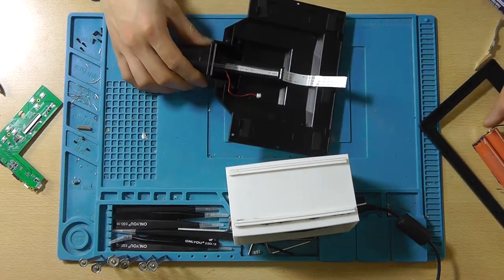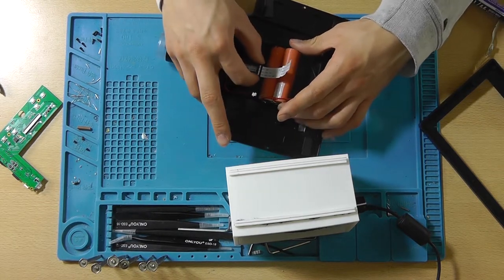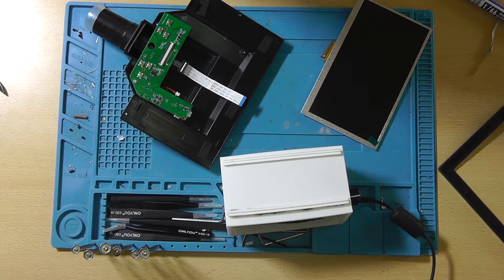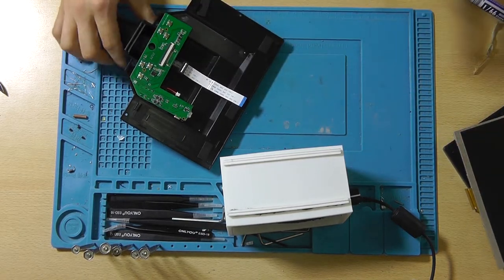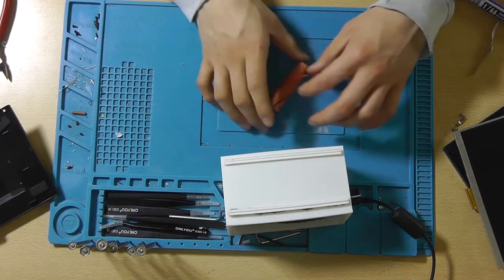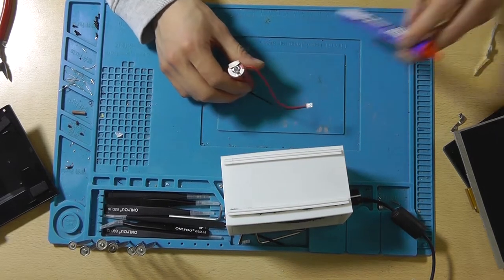Oh yeah, the batteries do need to go underneath the thing for the focus. So we should be able to fit a single 18650 in there. So we'll do that. We'll remove the second battery and we'll only fit one in there. Single battery is unfortunately the way to go, but it's better than no battery. I'm still glad that I'm able to even fit a battery inside this thing.